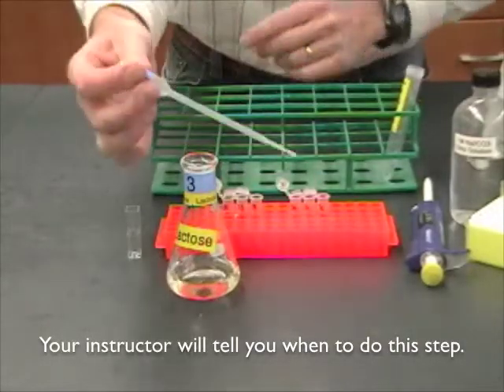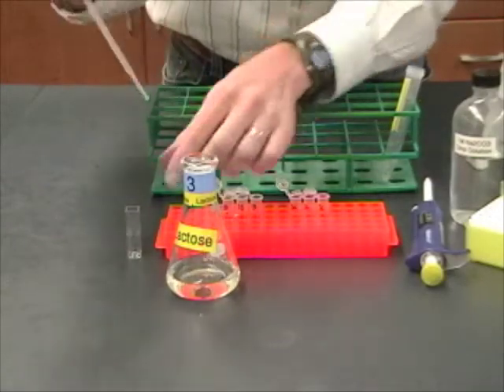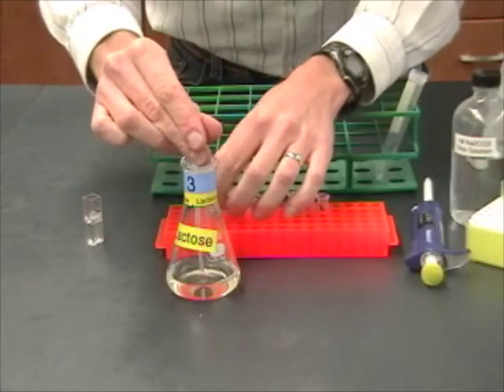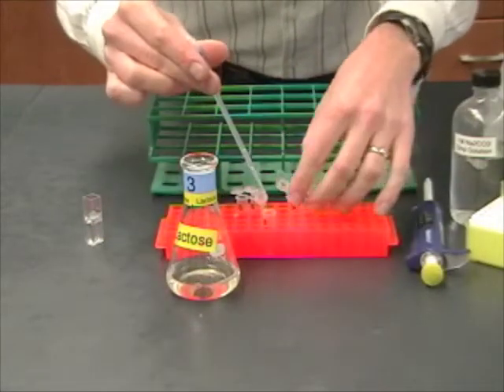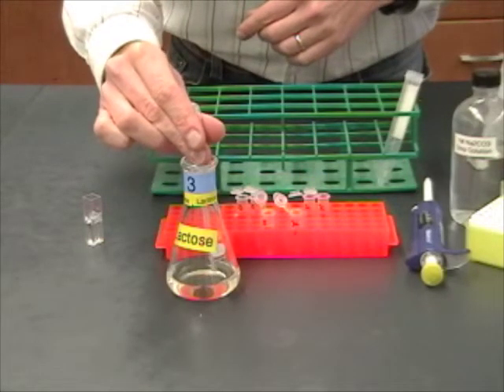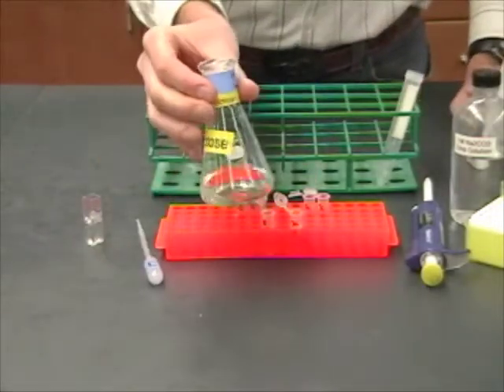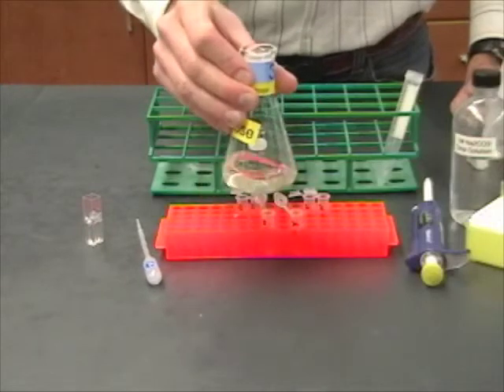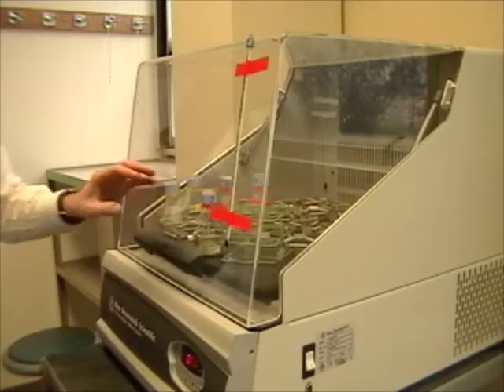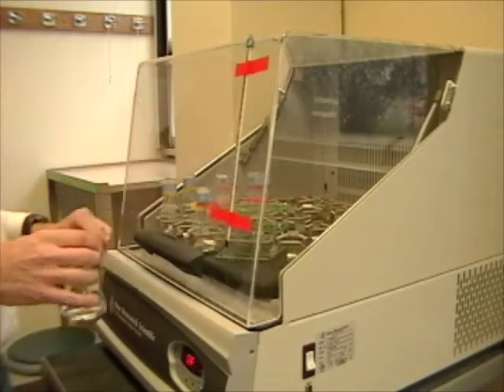Then, quickly, you're going to use this. This is the one milliliter mark on your labeled pipette. You're going to take one mil out and put it into one of these little spectrophotometer cuvettes. And, you're also going to take one mil and put them into the tubes labeled B and C. And, of course, these are the zero tubes, the zero time point. Okay. Now, before I do anything else, me and the rest of the people at my table are going to take these flasks and go put them in the incubator. I want to open this up and put my sample in quickly so that the temperature doesn't change too much. We want to keep this close to 37 degrees.